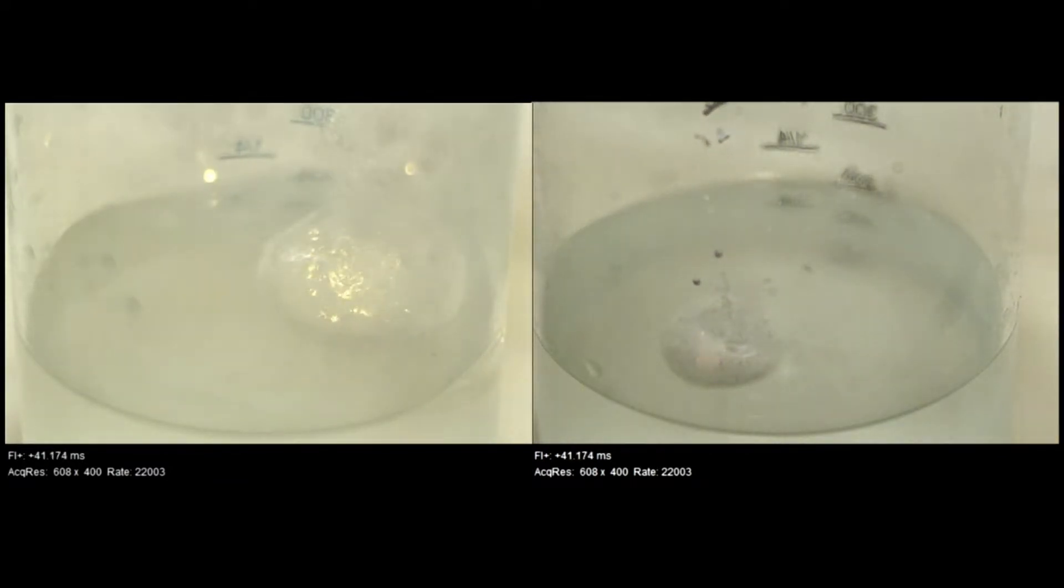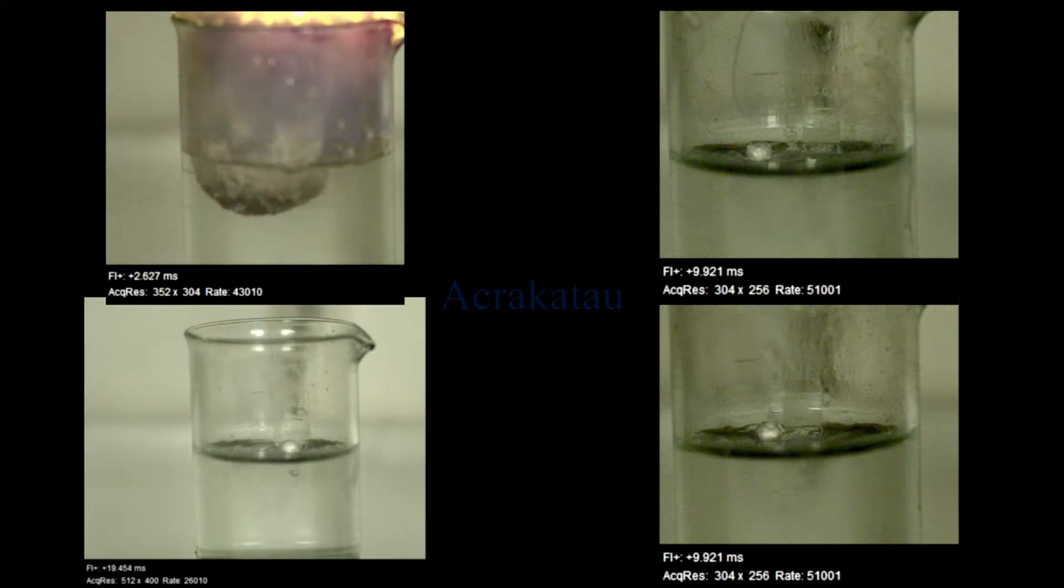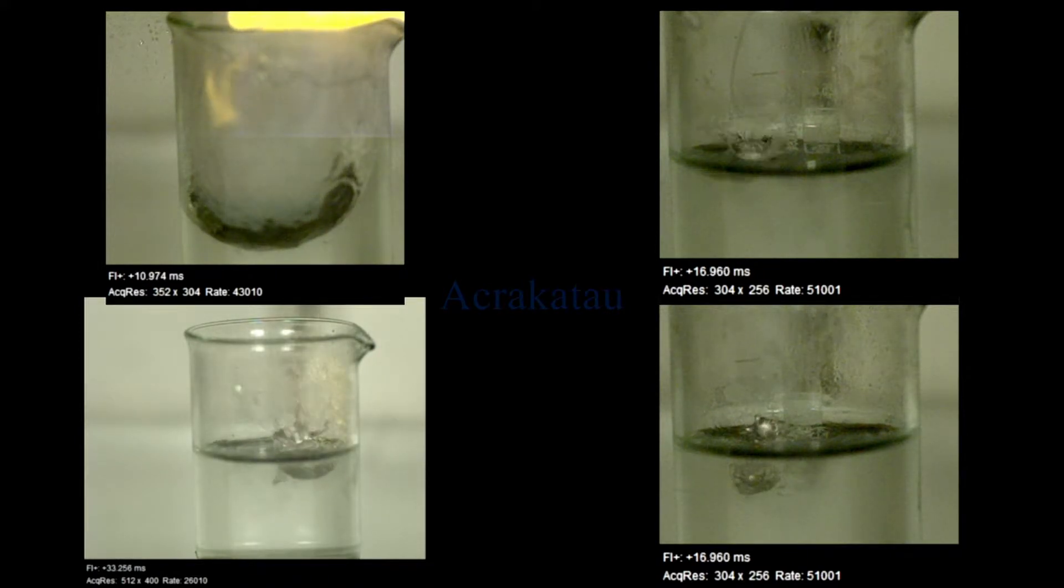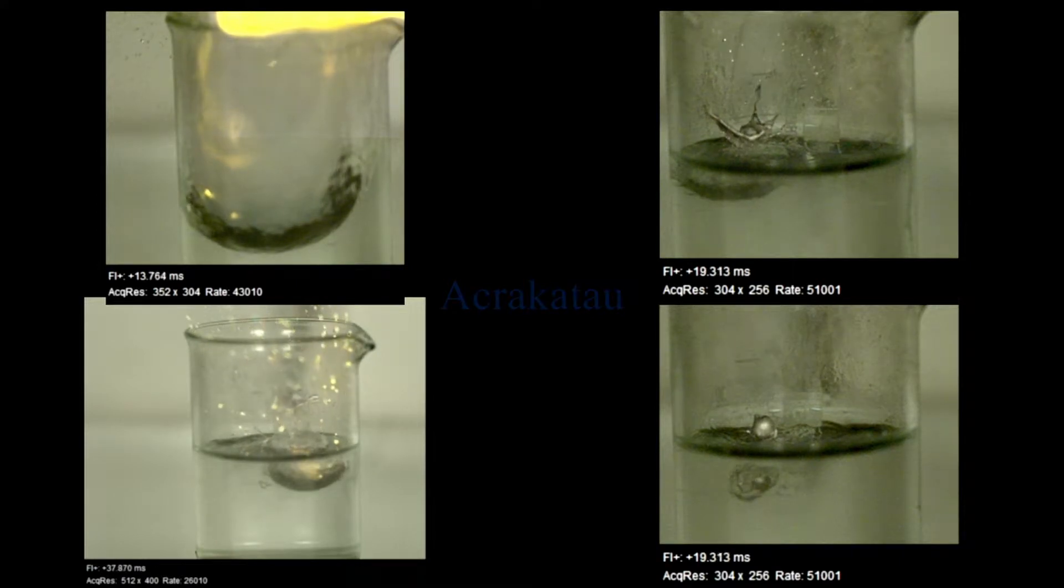And here are some more shots with a much higher frame rate. In the upper left corner, the sodium reacts in a very violent explosion. The front of the explosion moves at about half the speed of sound. But again you can see first the sodium exploding and then the flames shooting out.